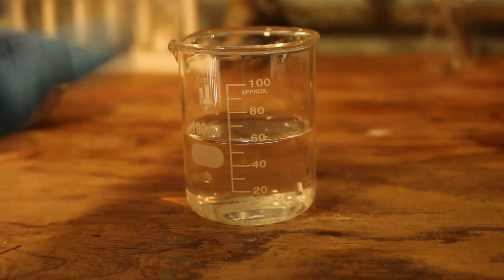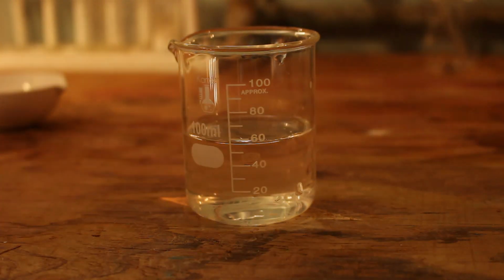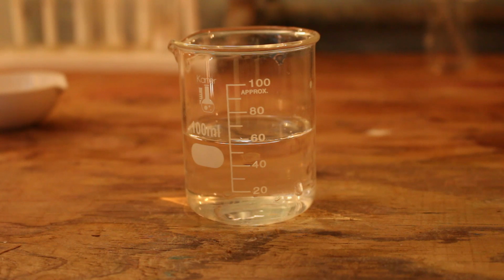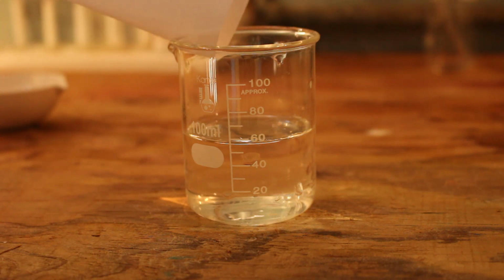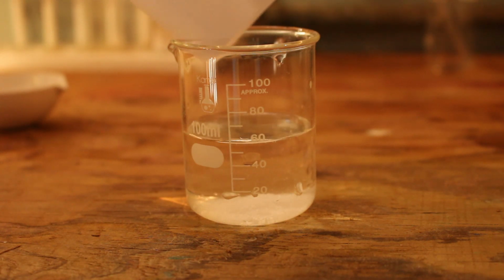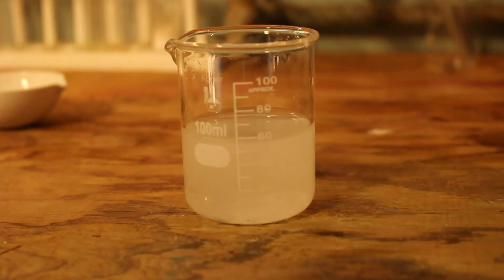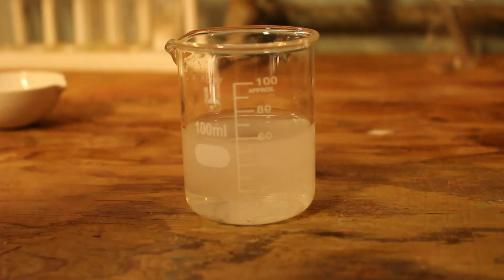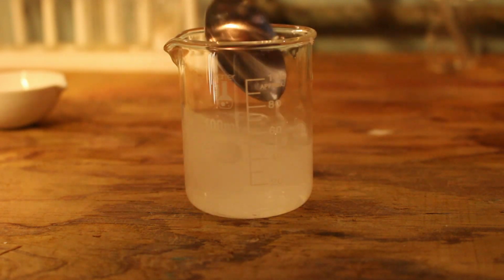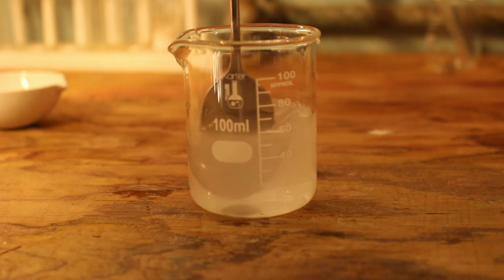Alright, so we've got about 57 milliliters of water. Yes, I know I shouldn't use a beaker. I don't care. Okay, we'll get our paper with our sodium hydroxide. And I will stir that up. Okay, so you might be like, that's clearly not enough water. And again, we're going to use our chemistry spoon. But it should be fine because the reaction actually produces water molecules as well. And it looks like it's all dissolving.